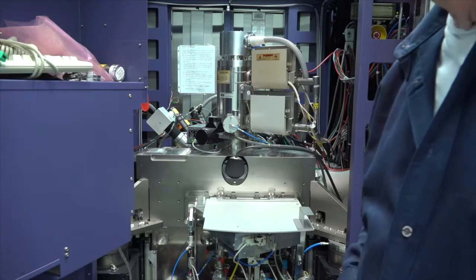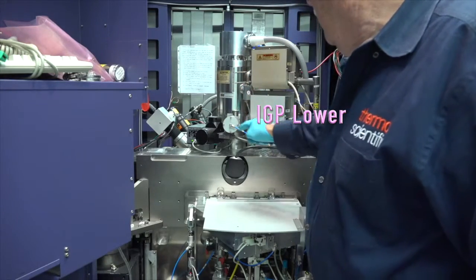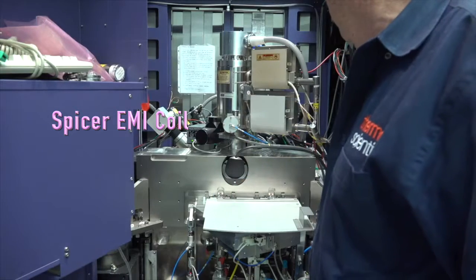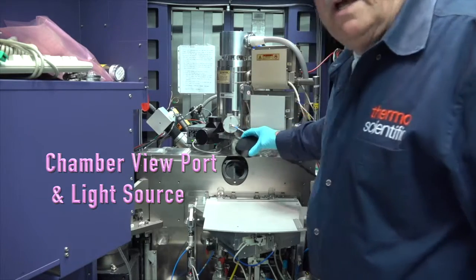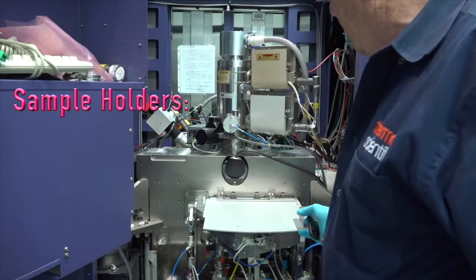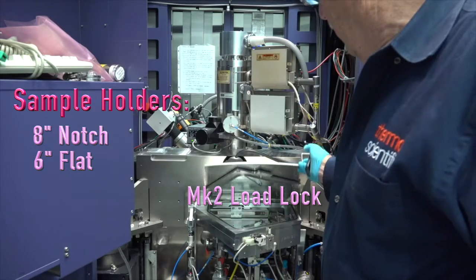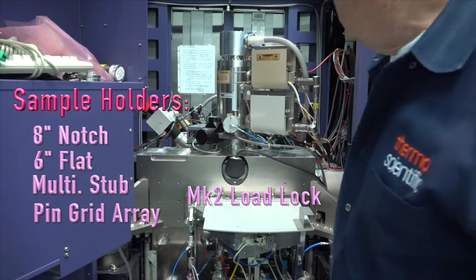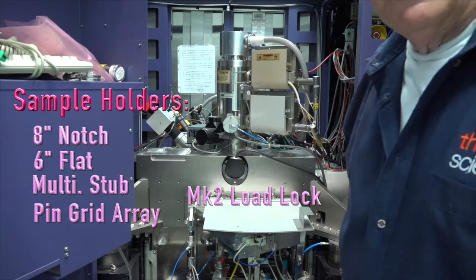Okay, this is inside the tool. You're looking at the electron column here, and the 2 IGPs we talked about, an AVA controller, and this is the sensor for the spicer field cancellation. In here we can also look inside of the chamber itself. We've got a viewport, it's a lead glass viewport. And then this is the load lock. I'll show you the different holders we use, but it'll hold an 8-inch wafer in there. And on the back side, which you can't see, that's directly behind the electron column, is the ion column. So we'll move around back so I can show you that.